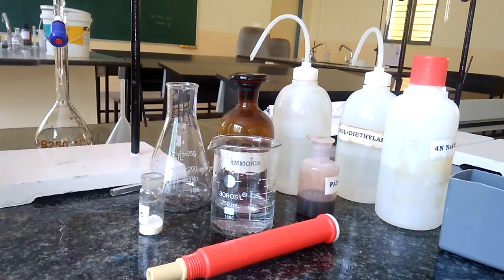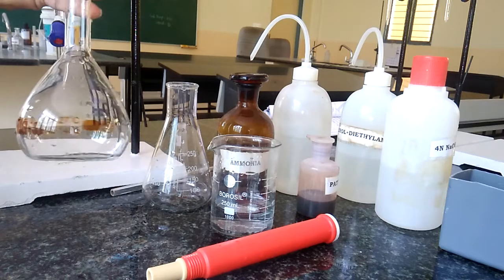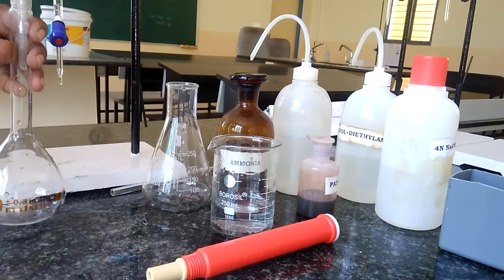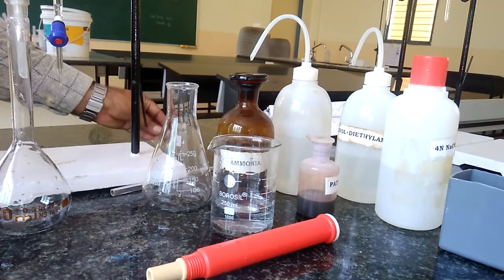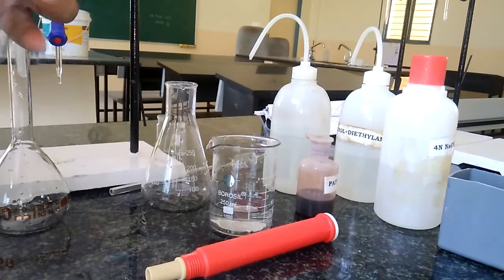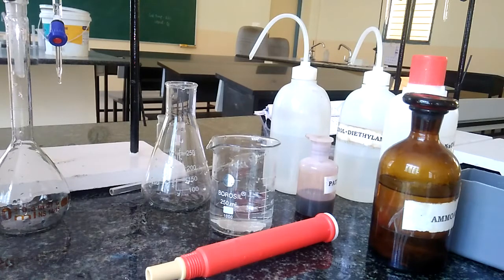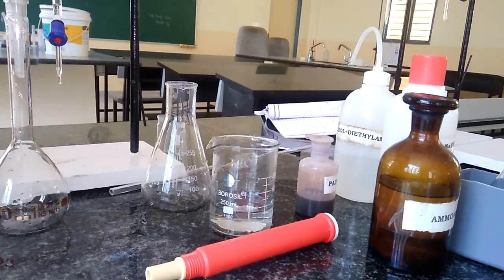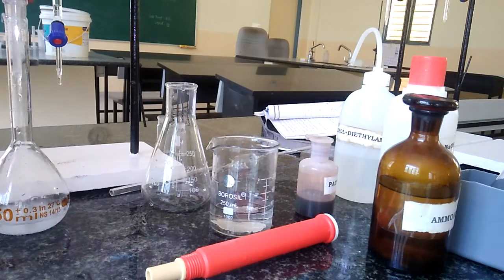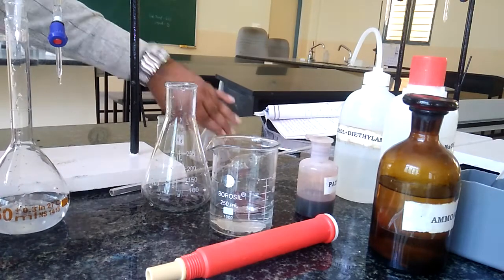Let us prepare the disodium salt of EDTA. For this, we have to weigh approximately 2.5 grams of disodium salt of EDTA and transfer it into a well-cleaned 250 ml standard flask along with a polythene funnel. Now I am transferring this, and it is dissolved by adding 5 cm³ of ammonia. Ammonia is added to increase the rate of solubility. I am adding approximately half a test tube of ammonia, which enhances the rate of solubility of the disodium EDTA salt. Now we will add a little quantity of distilled water. We have to add the salt through the polythene funnel and wash all the sides of this polythene funnel, then add a little more distilled water to the standard flask.